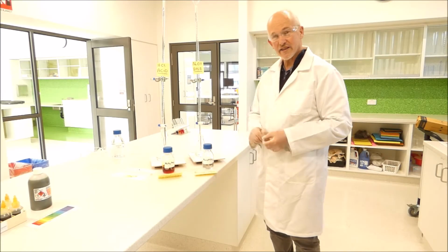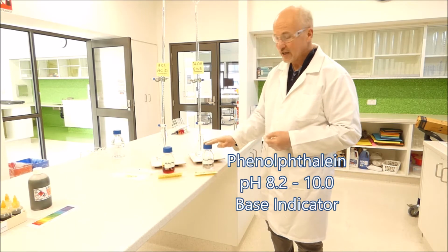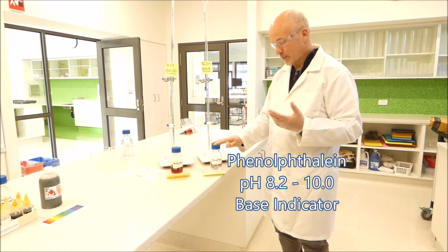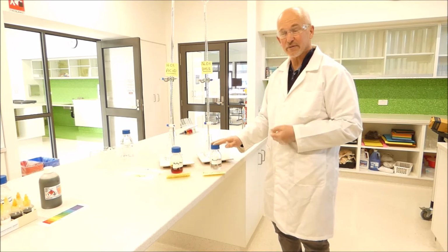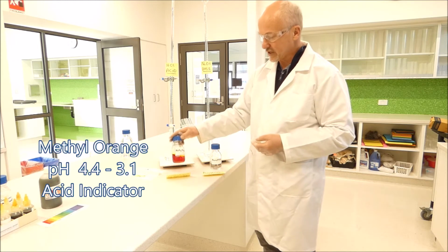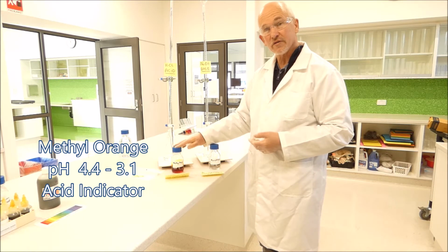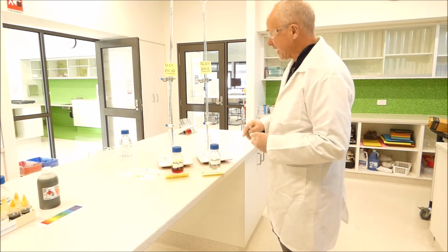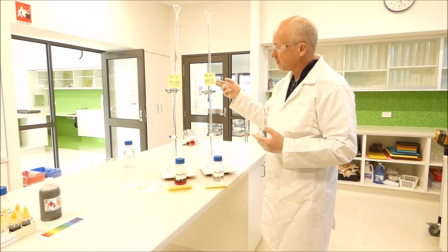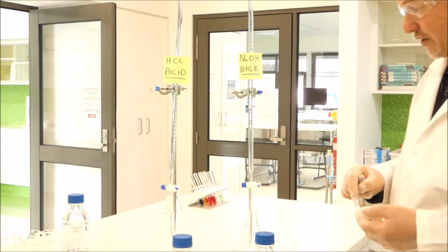For the first part of our experiment, we're going to test two of our indicators. We're going to test phenolphthalein, which is a base indicator, which changes at around a pH of 8.2 to 10. And we're going to test an acid indicator, which is methyl orange, which changes at about 3.1 to 4.4 pH. We'll do that by using our burettes to let either a sodium hydroxide solution, a base solution, in slowly, or an acid solution in slowly.